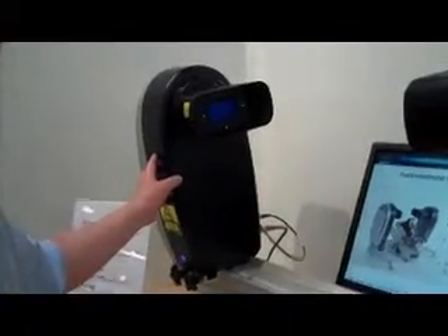Let me take you through the instrument. Over here we have the transmitter. Inside here we have our laser light source — it's a helium-neon laser. It gives us a very intense source of light, so we can see a lot of scattering from the particles we're going to measure. We turn that laser beam through a right angle and expand it so that we illuminate a cylinder through the measurement zone here that's about one centimetre across.